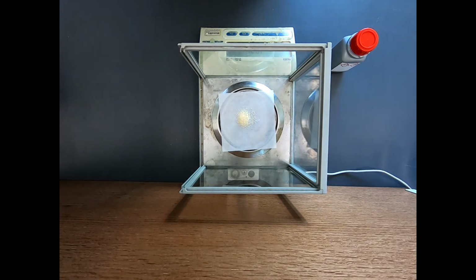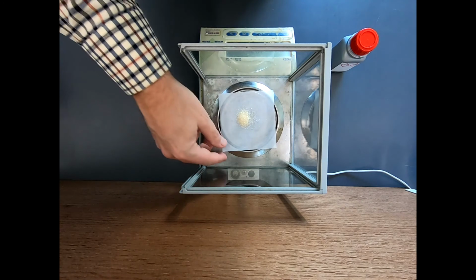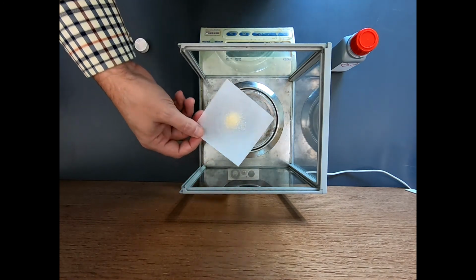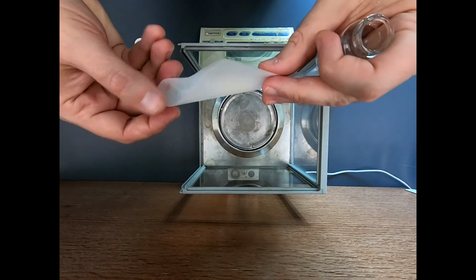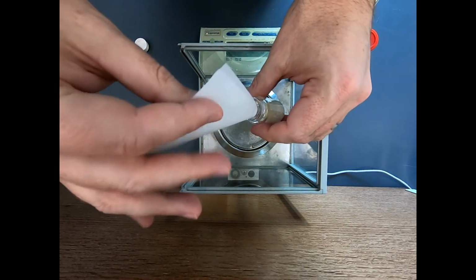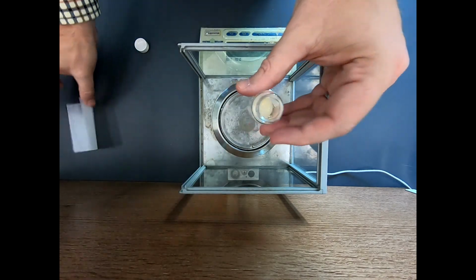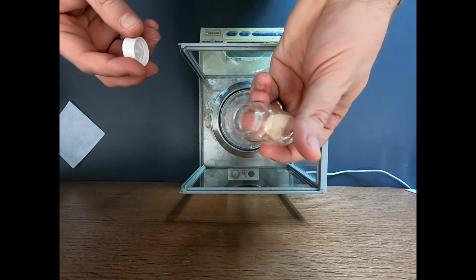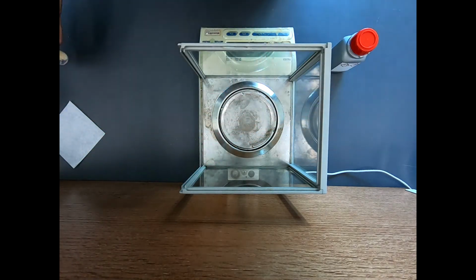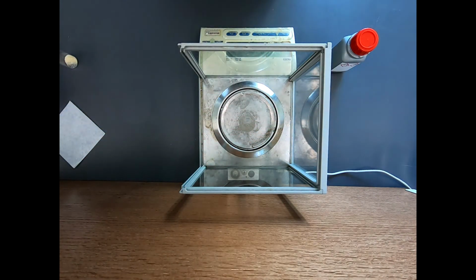So let's just go ahead and take this. I did not fold the corners. Typically I try to remember to fold the corners. It makes the paper just a little more rigid. And take that out. And now presumably we have 1.074 grams in this vial. And now I'll calculate the amount of para-toluidine I need, and we'll get as close as possible for that reagent.